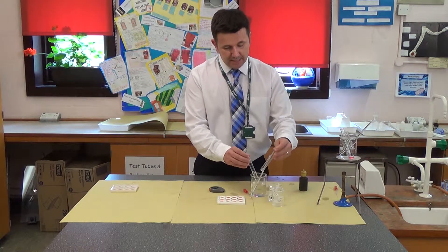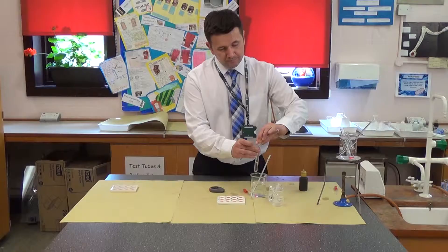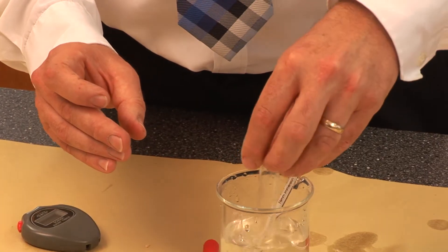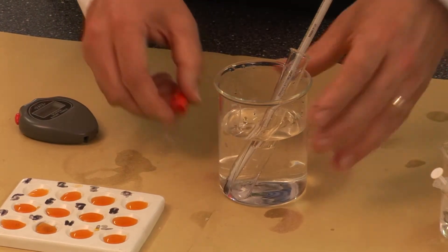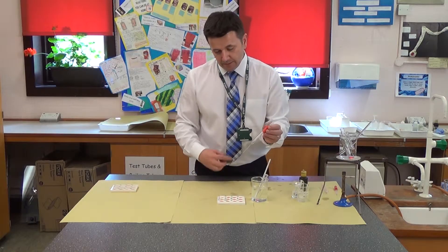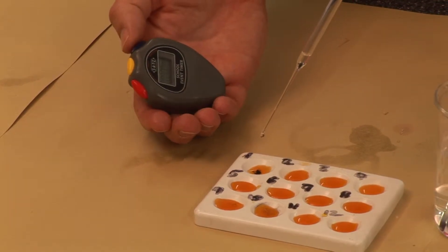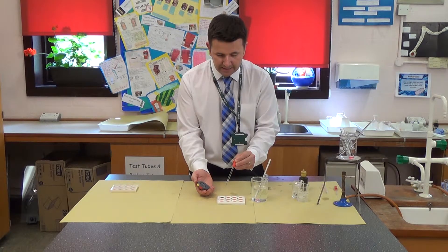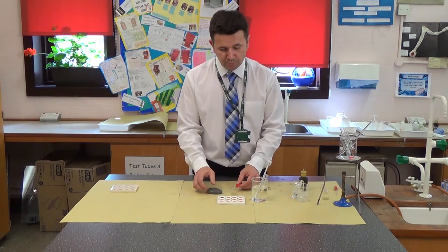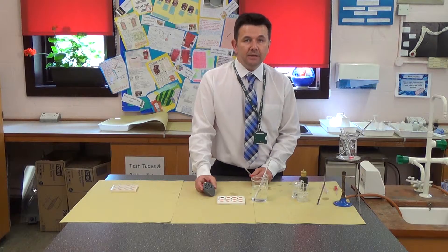I'm going to mix the starch and the amylase together, shake it to make sure they mix, and then place them in my water bath. Immediately, I take a sample and put a couple of drops onto the spotting tile as my start point, then start the stopwatch. As you can see, it goes black — the reason it goes black is that there is still starch present in that solution. I'll wait one minute and then test again.